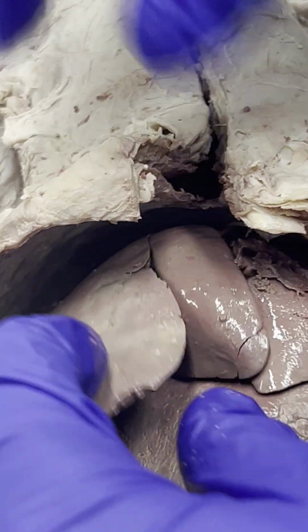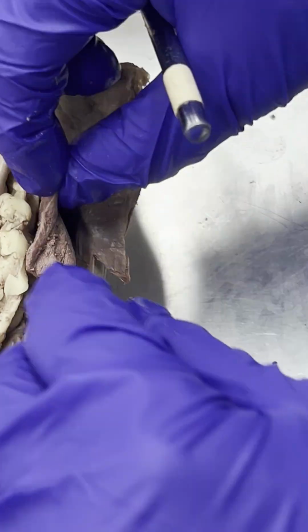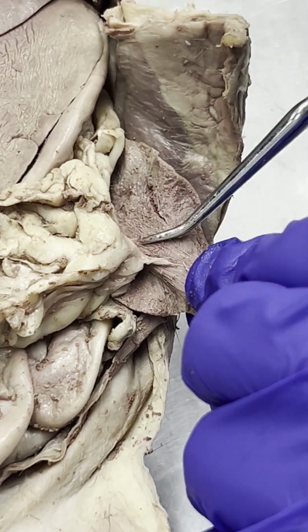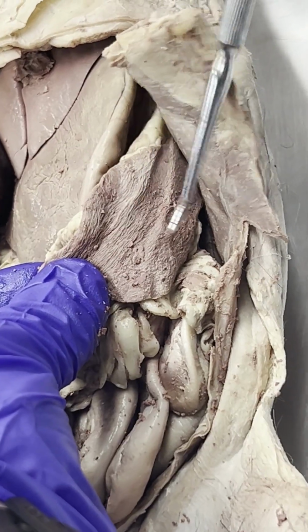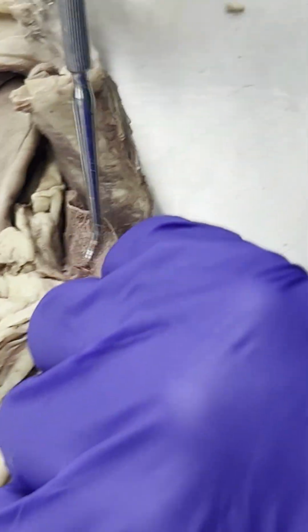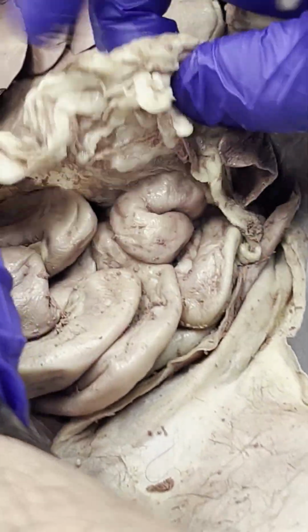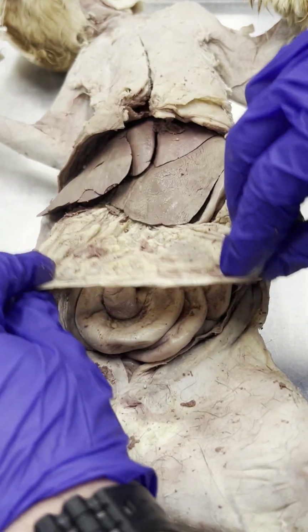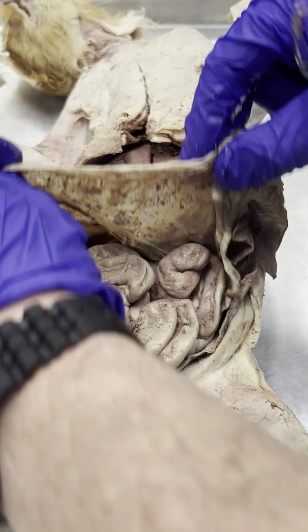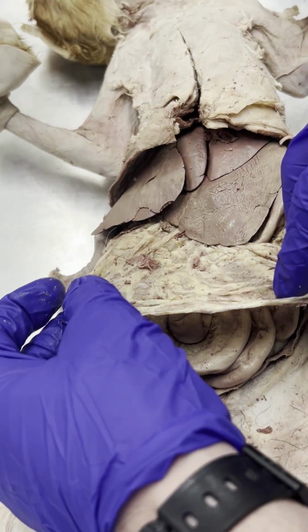All right? We also have the spleen of the cat. So the spleen of the cat is going to be right here. So here is the spleen. It's this darker structure right here. Hopefully I'm not going too fast for our camera woman, Dr. Mick. So there's our spleen. We also have the greater omentum, which is all of this. Here's our greater omentum. As Dr. Mick would say, it's the protective blanket of the abdominal organs.